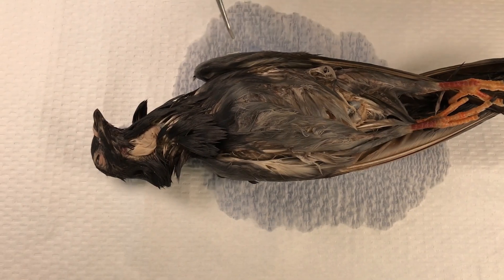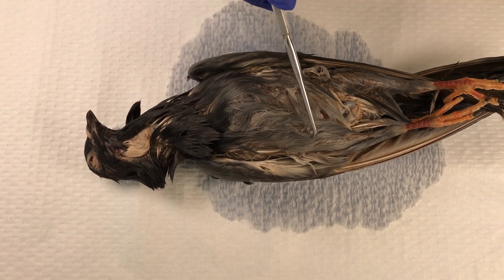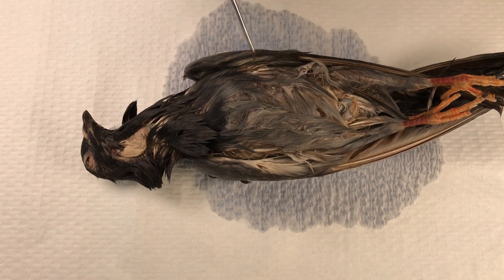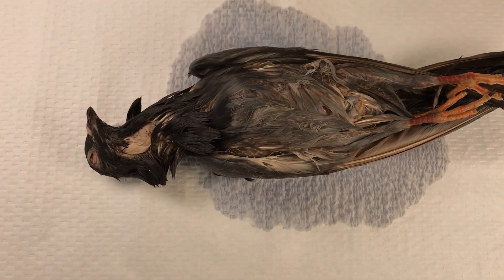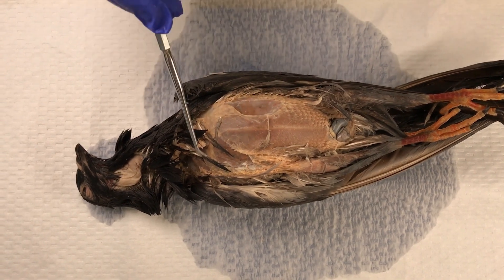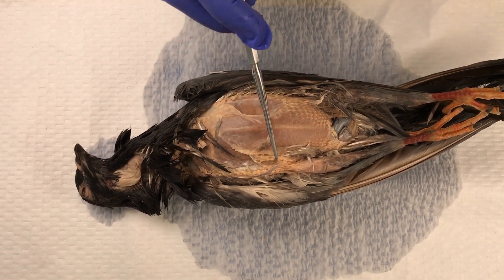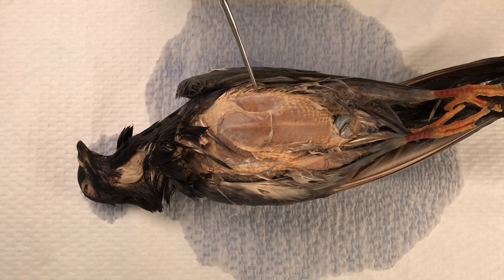Now to see the internal features of the pigeon, we're going to clear an area of the animal here of its feathers. Once those feathers are removed, you can more clearly see the area to be cut open to reveal the internal structures.